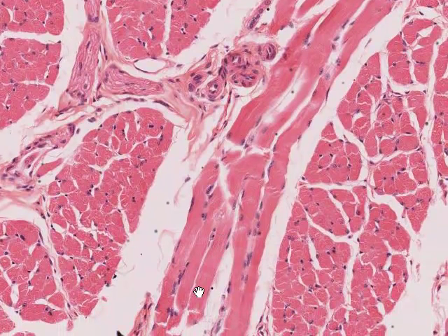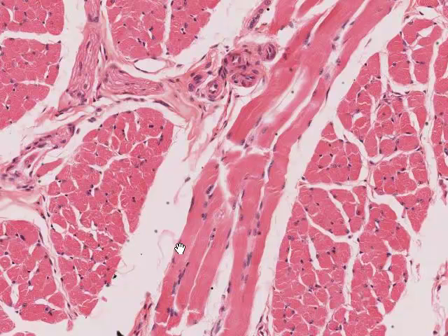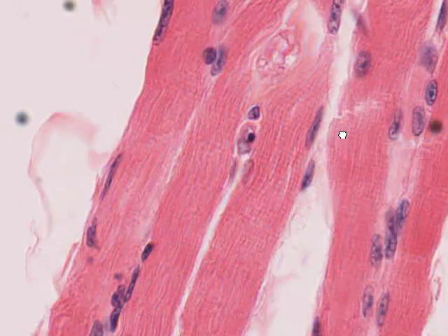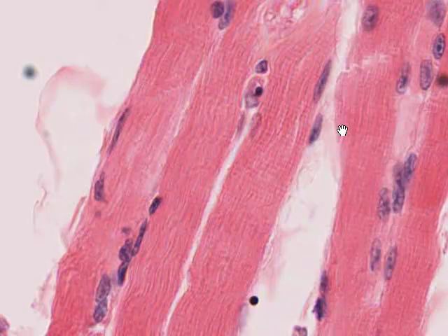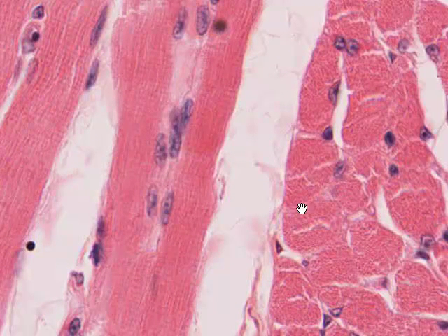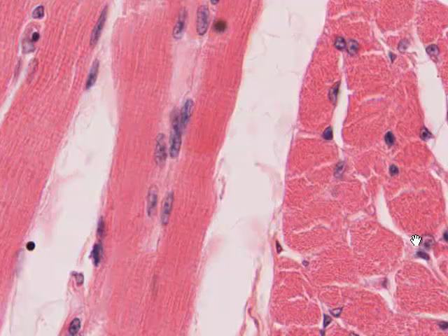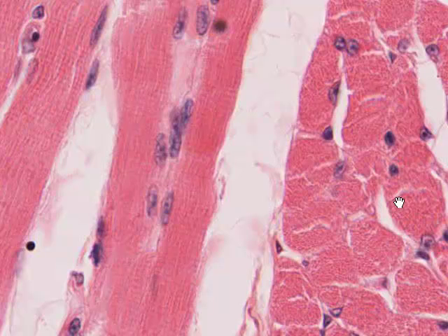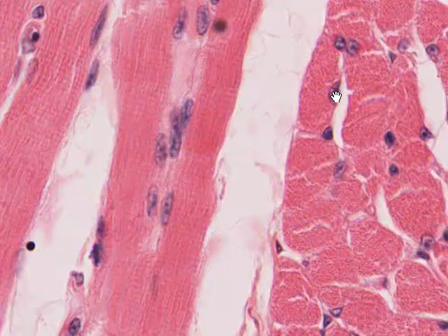The first thing to notice is that these long fibers lie essentially parallel to one another, and broadly speaking the nuclei are towards the periphery of the cell. Going to maximal magnification, although not as perfect as we might see on specially prepared muscle, we can see the cross striations which are characteristic of skeletal muscle cut in longitudinal section. Beside it, skeletal muscle cut in cross section shows end-on profiles of individual myofibers, and the myofibrils give a punctate or spotty appearance. Cell nuclei are pushed completely toward the periphery of the cell.